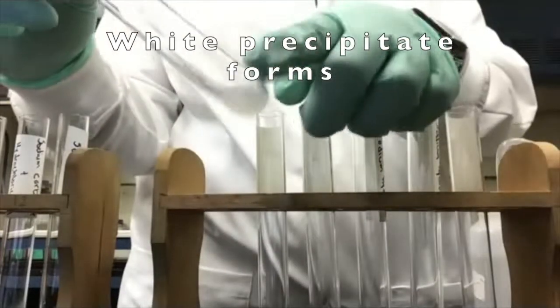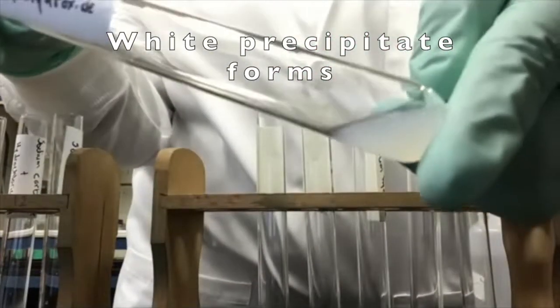Cadmium chloride and sodium hydroxide give us a white precipitate in our solution.